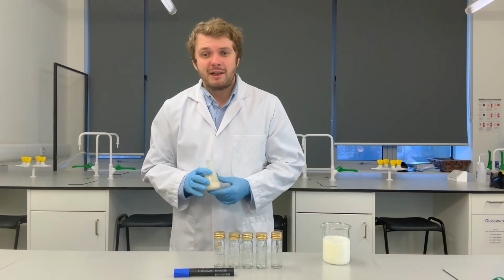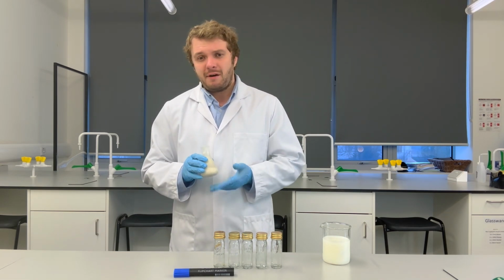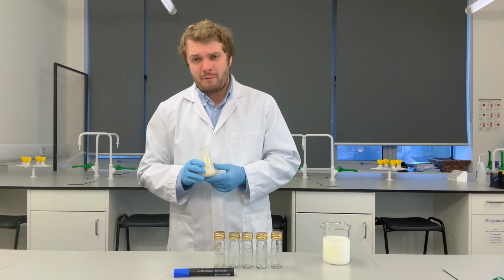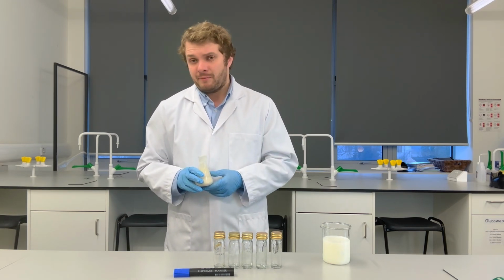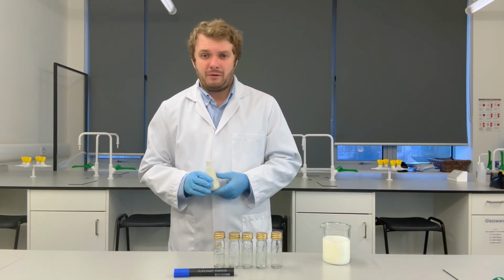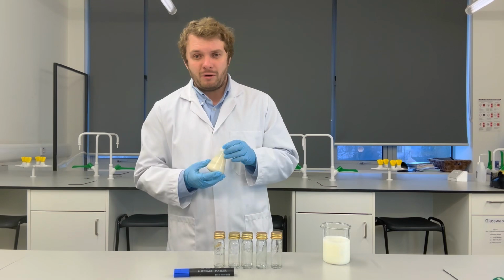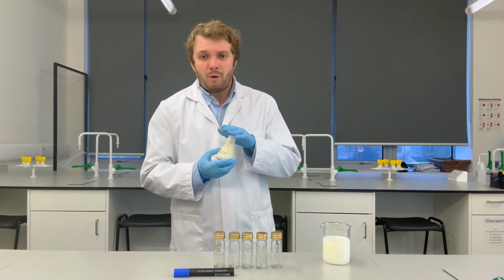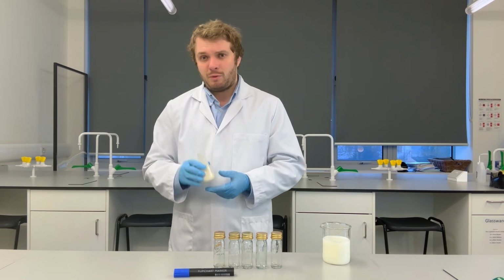In this small flask, I have a Kefir culture that I commenced a little over 24 hours ago by inoculating some sterilised milk with a commercial culture that I purchased from a manufacturer, so I know exactly which organisms are contained within it. I inoculated the milk, sealed the container, and placed it in a warm space for that window of time. And the concoction of Saccharomyces and lactic acid secreting organisms have been busy making this place their home by colonising the milk during that time, and it's now ready for use in our stage 1 practical.